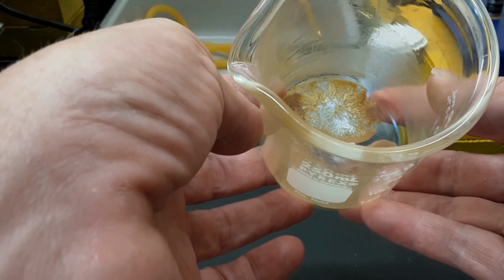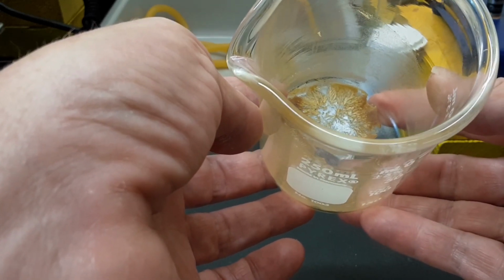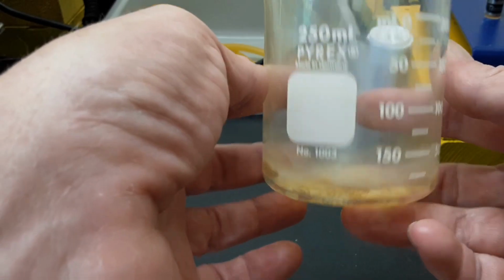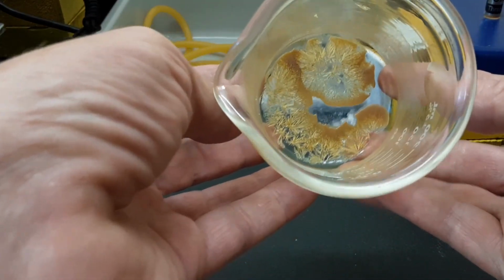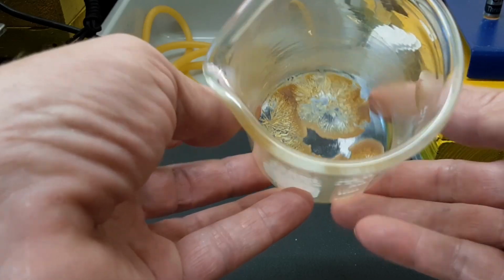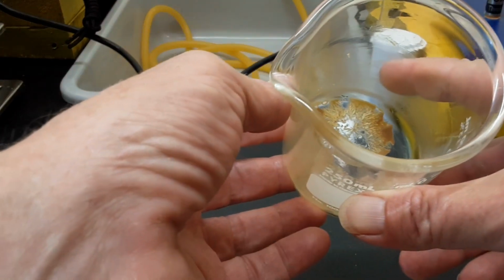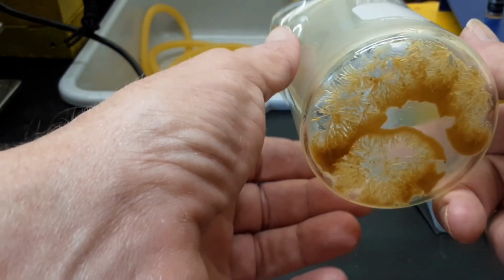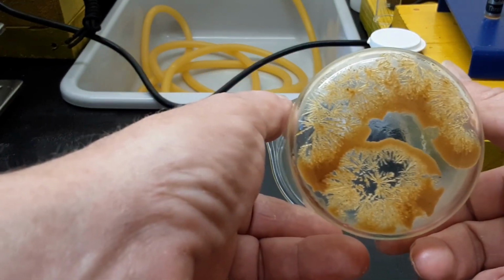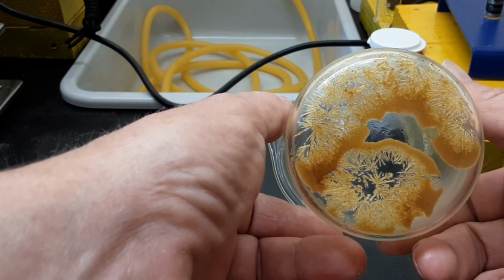The color was very, very solid yellow, and it had a very good solid look to it. But unfortunately, I just don't know what happened here. When it went into the funnel filter, it looked quite good, and I had really high hopes for this. And then when I tried to crystallize it is when I ran into problems.